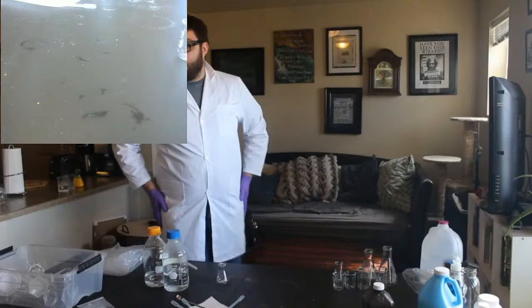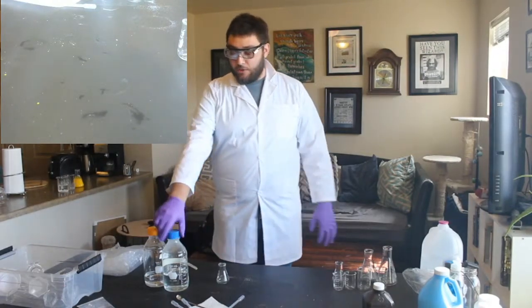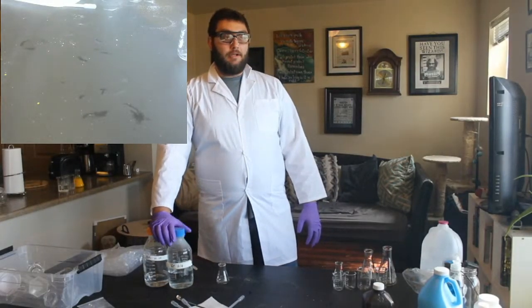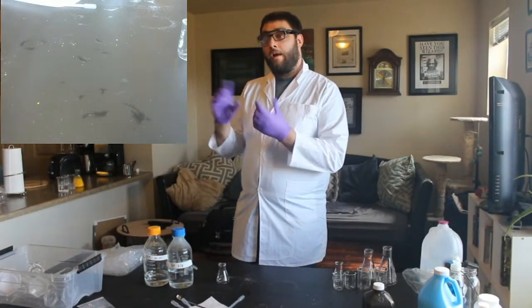Why does it change yellow and not white? Because it made something different. So these two white ones, the acid and the base, I believe it made a lead mixed with a nitrogen and a hydrogen, or an oxygen and a hydrogen.